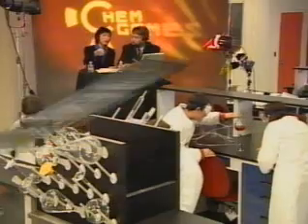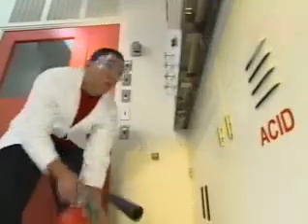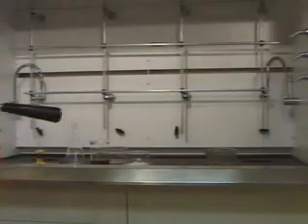Fire! That's right, Mia. There could be a fire. No, Adam, there's a fire over there. Whoa! But look! There's a fire extinguisher. They're all over it, and it's out.